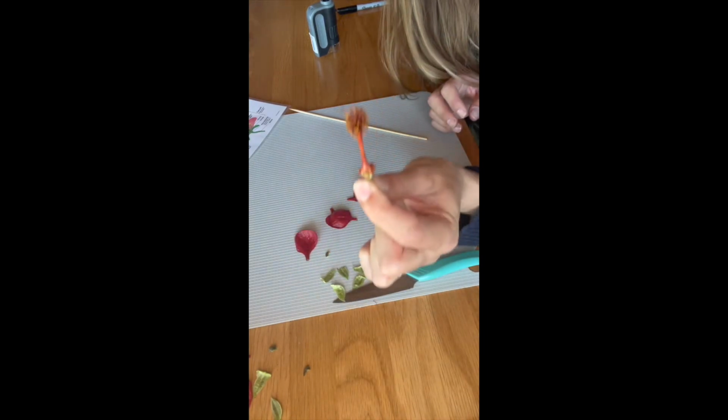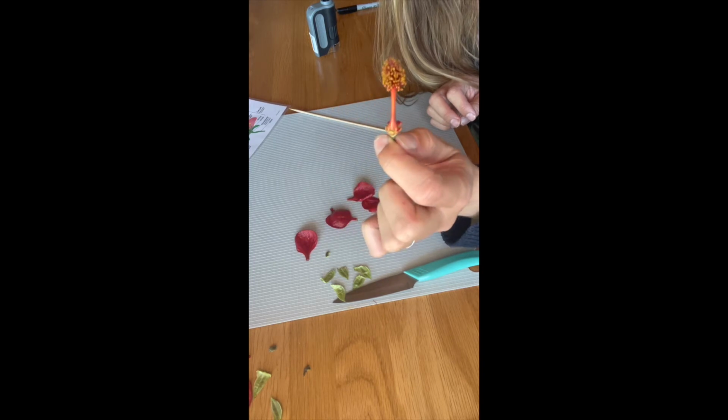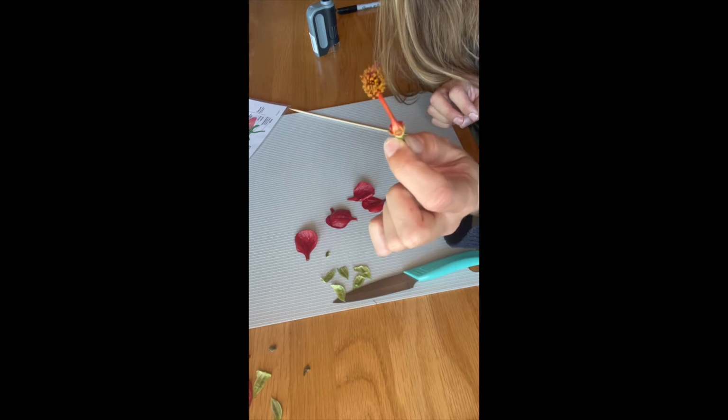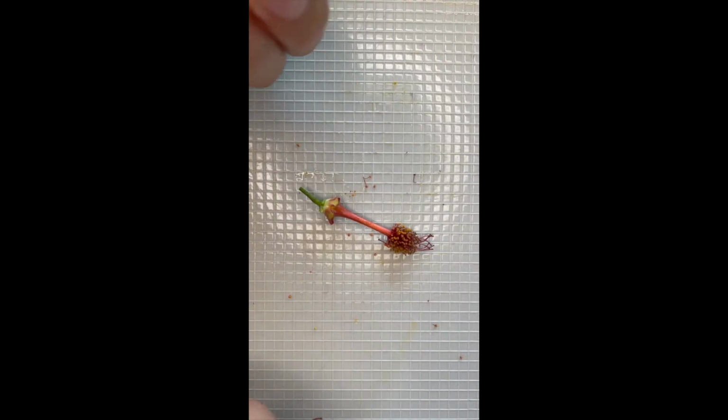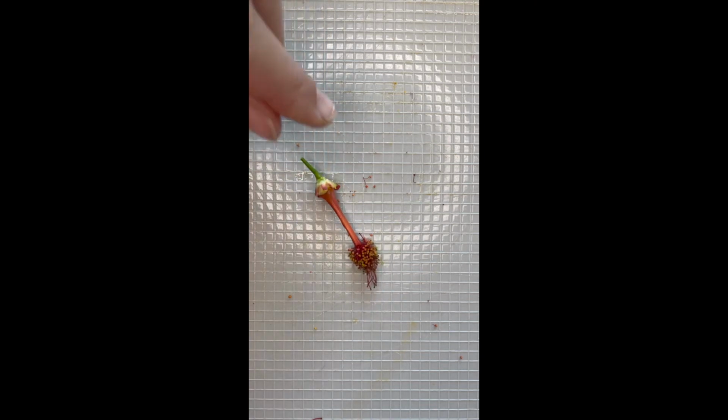So here we have what's remaining, and these are where all the action happens, the male and female parts. So as I dissect this, I'm going to get in really close with the camera. Okay, so here we have our reproductive parts of the flower, and my hands are just covered in sticky nectar after pulling those flower petals off, which is kind of cool. I bet the hummingbirds love these flowering maples.